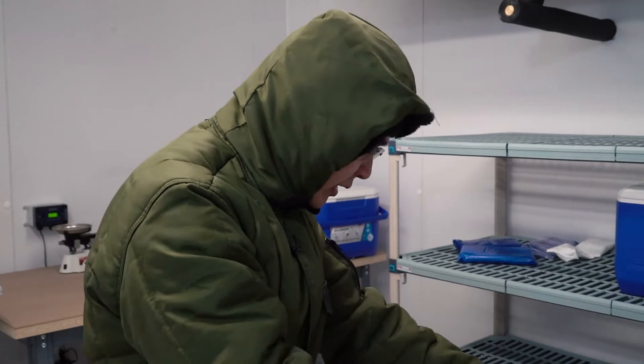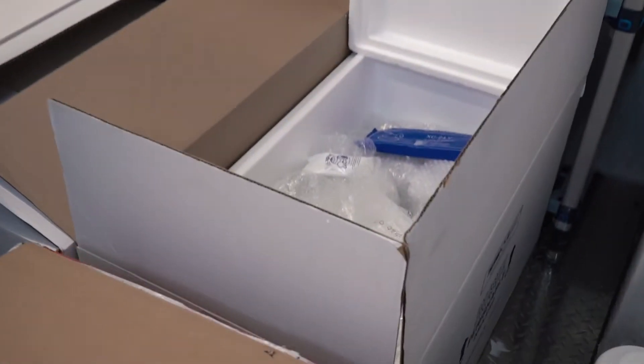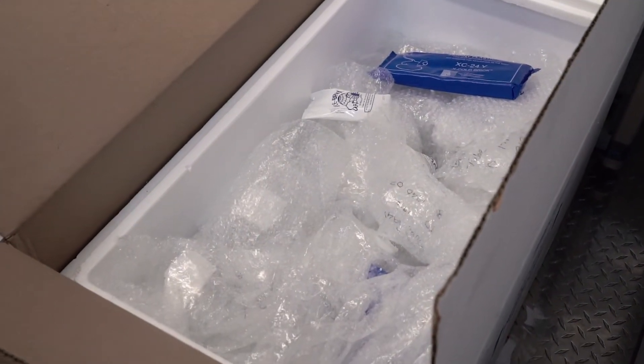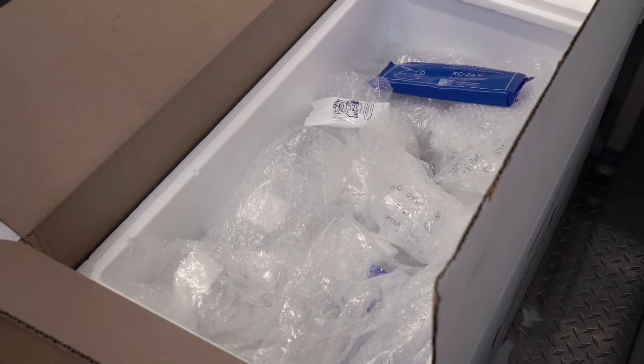We are in the Rice University ice core lab, the only one we have on campus. Right here what we're looking at is glacial ice from Antarctica and Greenland.